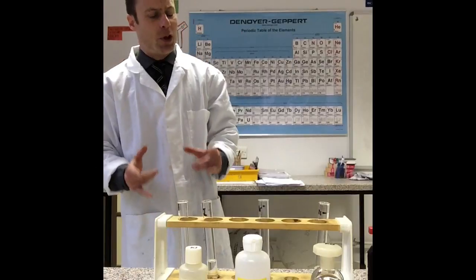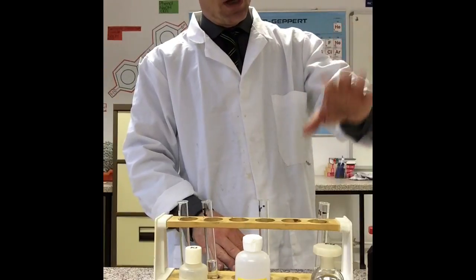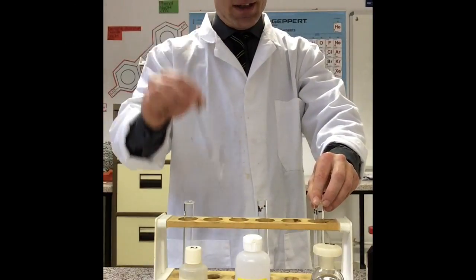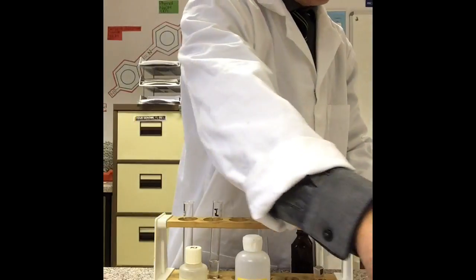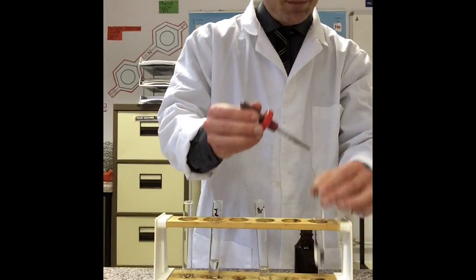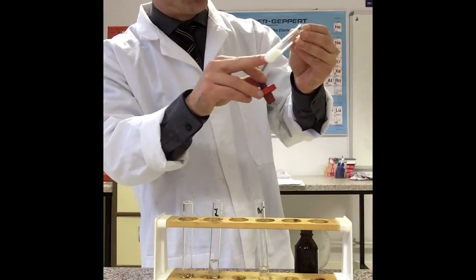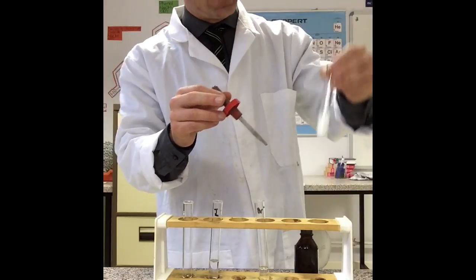I hope you had time to do all three halides, so let's go through and make sure we've all got the same results. In this test tube I've got a solution of potassium chloride, in this one potassium bromide, and this one potassium iodide. I'm going to add my silver nitrate solution — we know that that is chloride. I add in the silver nitrate and you notice I get a precipitate; it's definitely a solid, I can't see through it, and that's a white precipitate. Chloride gives you a white precipitate.